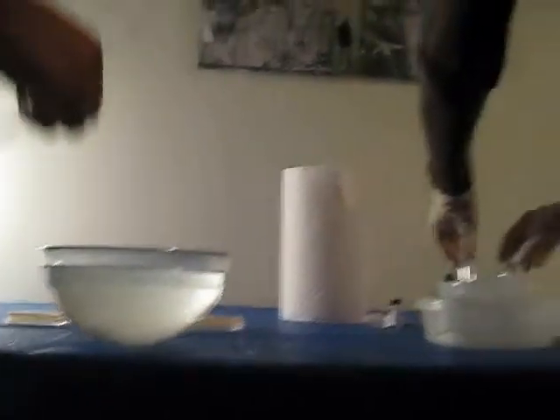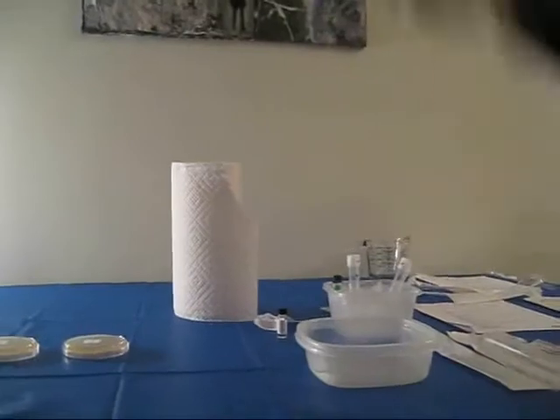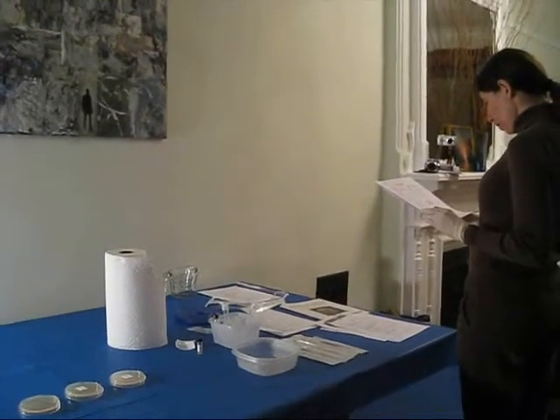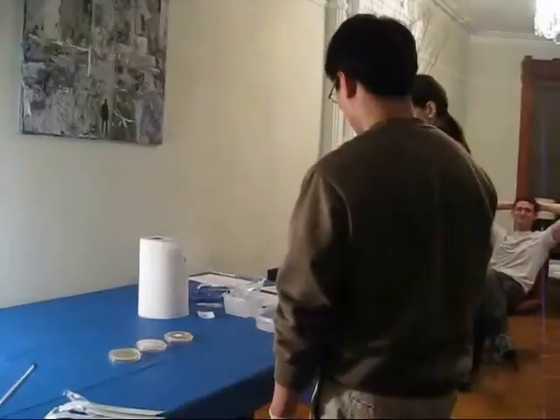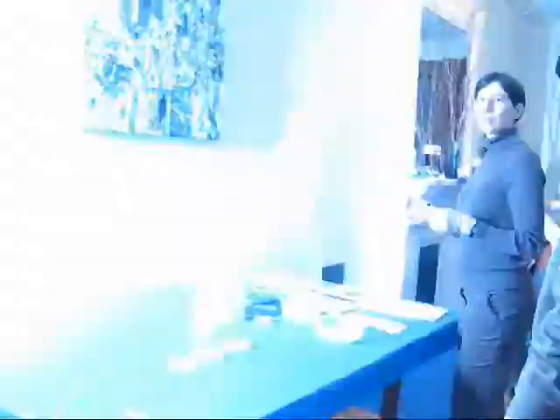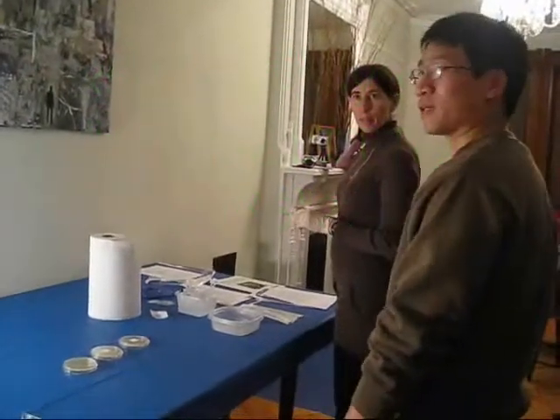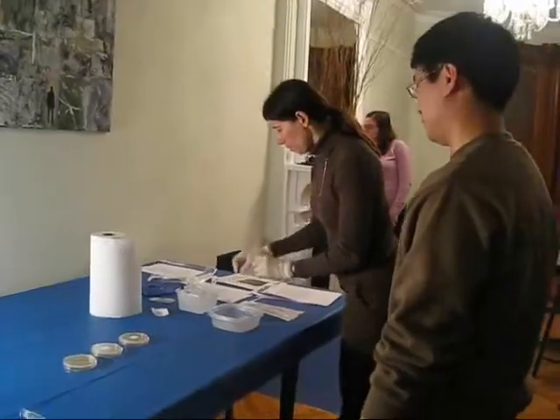They should be transformed. We've done it. One to two minutes and then the Luria broth. That's just food for the little guys — it's nice, happy food. He's shocked and very unhappy. We're making them happy. So you're going to feed them to make them feel better.